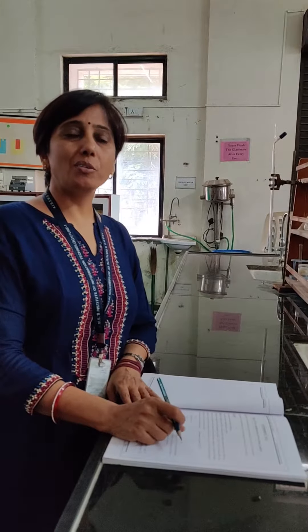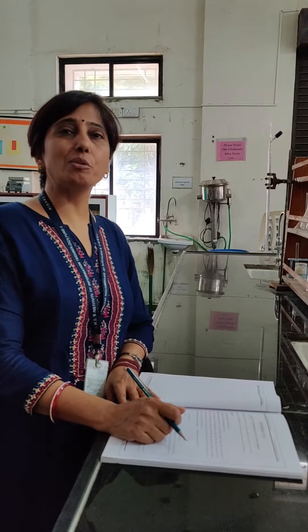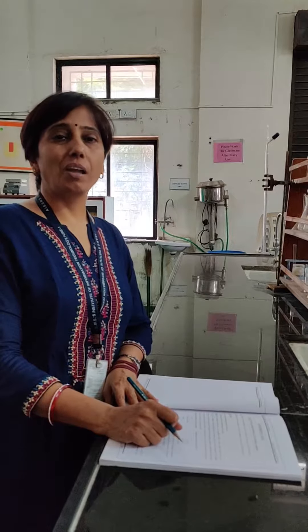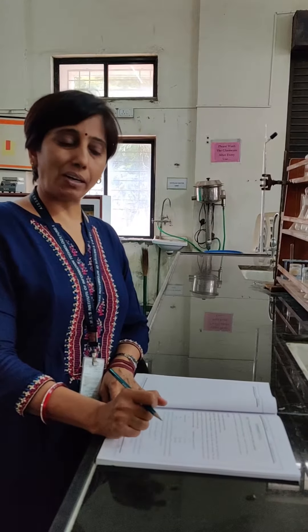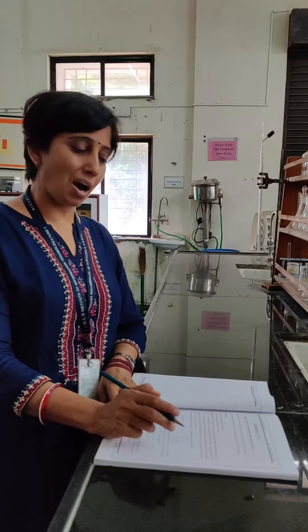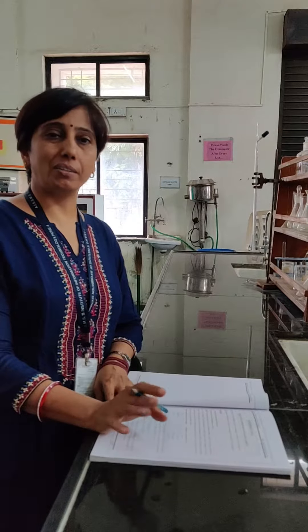Hello all, I am Dr. Nidhi Sharma from AIS SMS Institute of Information Technology. Welcome you all. Today I am going to give the demo on the practical which is based on estimation of total hardness of a given water sample by using the EDTA method.